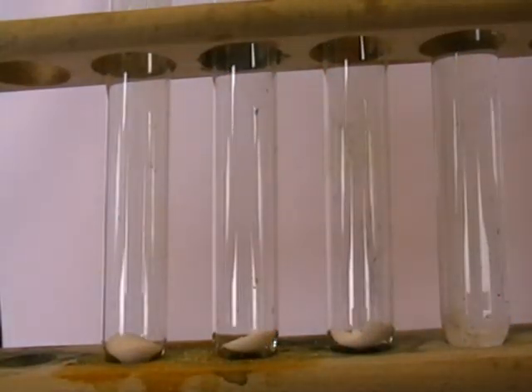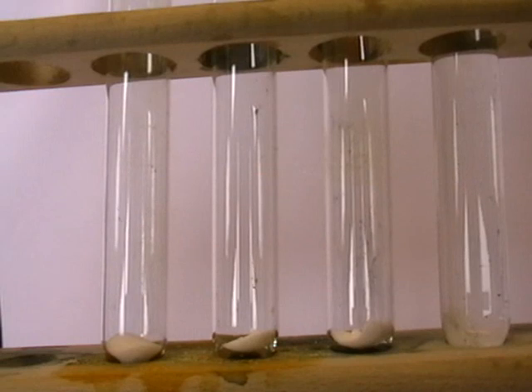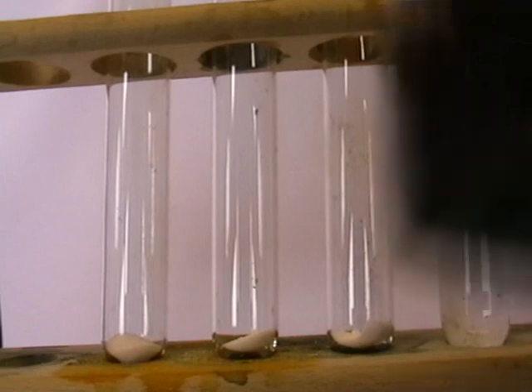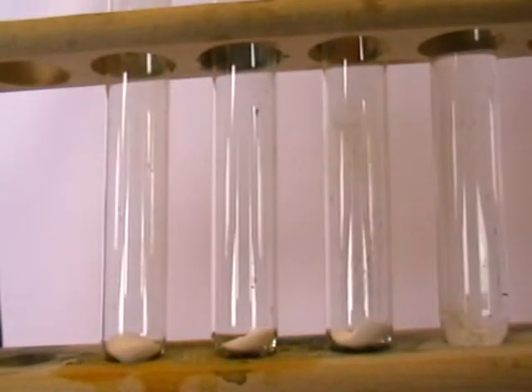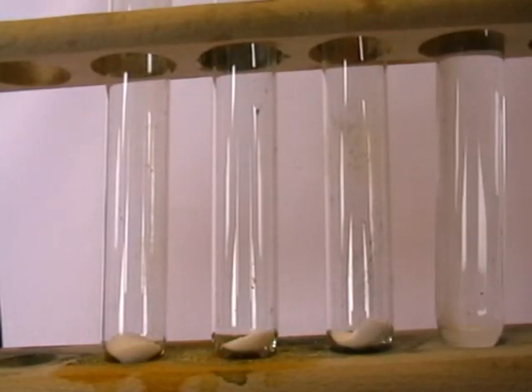Let us take a look now at the reaction of the halide salts with silver nitrate solution. I'm using 0.1 molar silver nitrate solution, which I have in this boiling tube on the right.